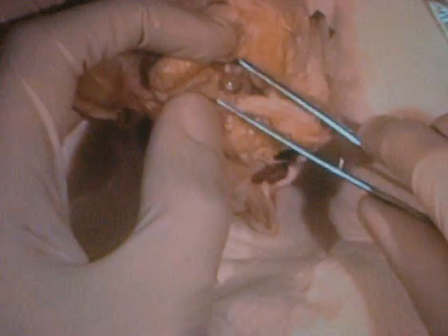When we turn the eye around to the back, we can see some fat that helps hold the eyeball in place. We can also see the attachment of the muscles in that pinkish-purple color, and this little part that looks like a tail — that's the optic nerve, which connects the eyeball to the brain.